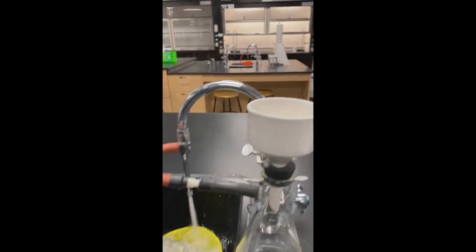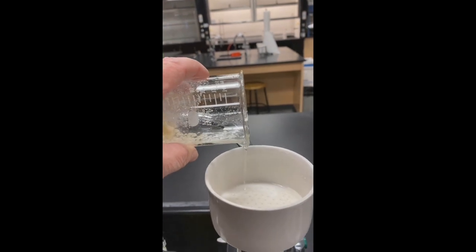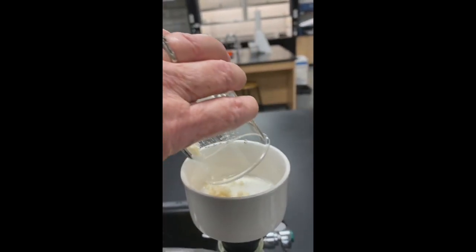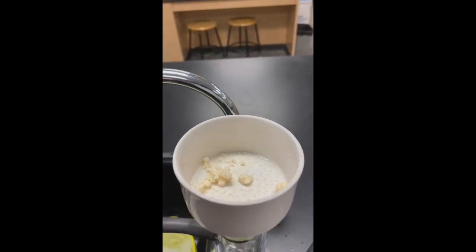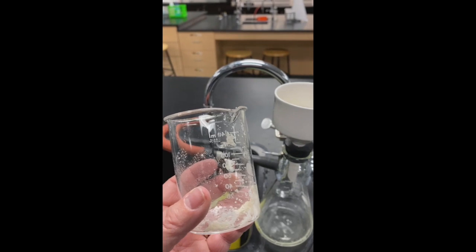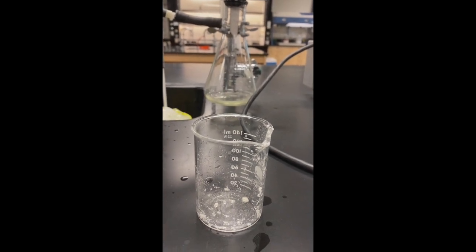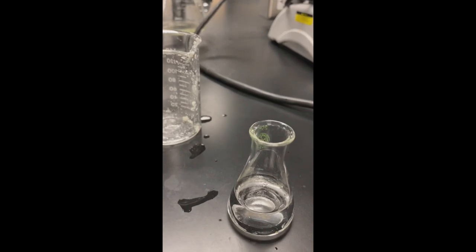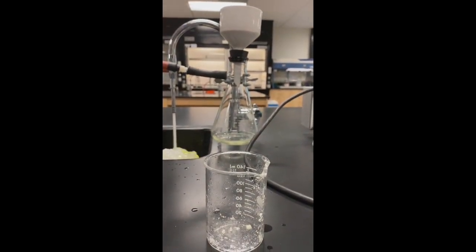Here's the setup. I'm going to pour in my liquid as much as I can that keeps it from clogging it up and then get the solid in there and I will be drying my crude crystals. I'm going to take a glass rod and get the rest of this out. So I have a little bit of solid left in my beaker so I'm going to rinse with a little bit of cold water to get all of it into that Buechner funnel so I can get a better percent yield.